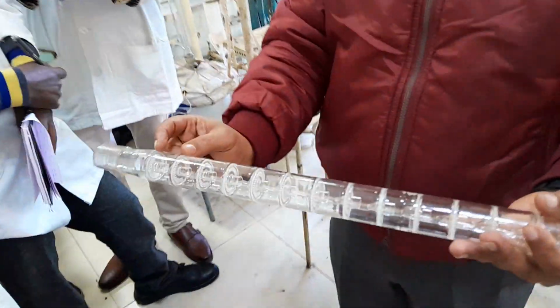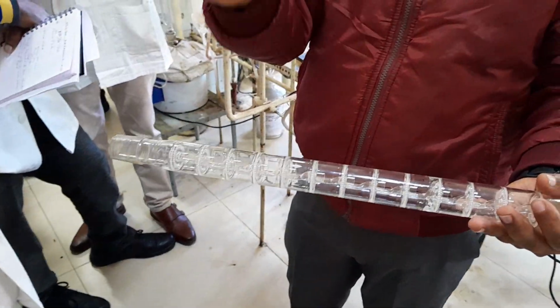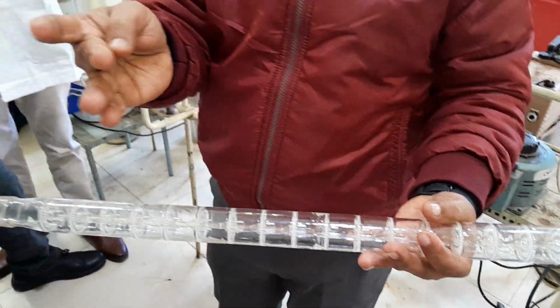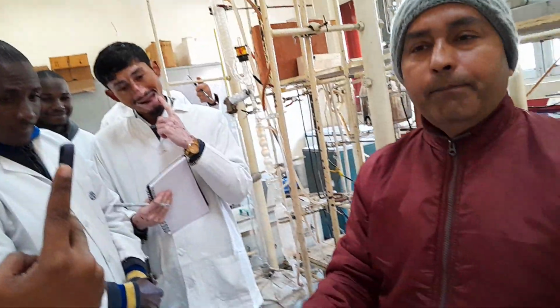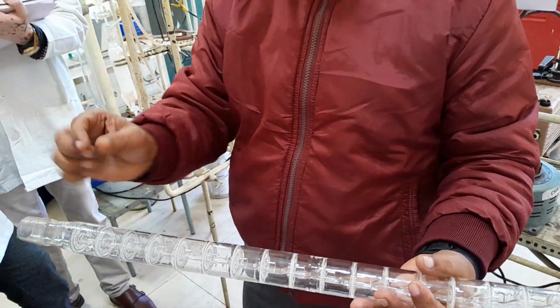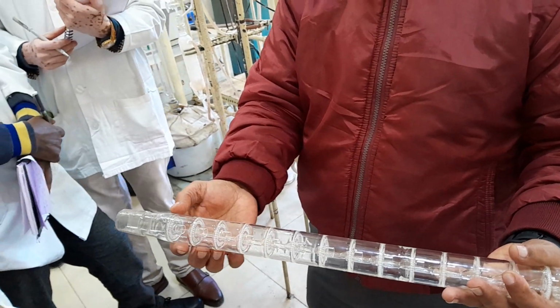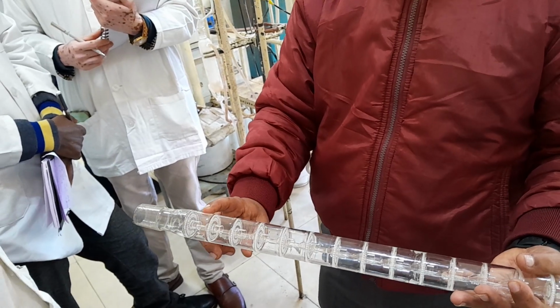Now talking about HETP or one theoretical plate. For example, if the IBP or initial boiling point of the vapor is 20 degrees, along with that 20 degree centigrade, 30, 40, 50 degree centigrade boiling point compounds will also come out. But what will happen? When time and again you are sending the liquid back into the column for the interaction, there will be an equilibrium of 20 degrees between these two plates.